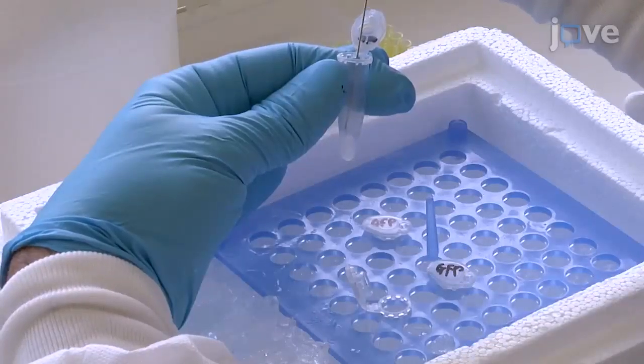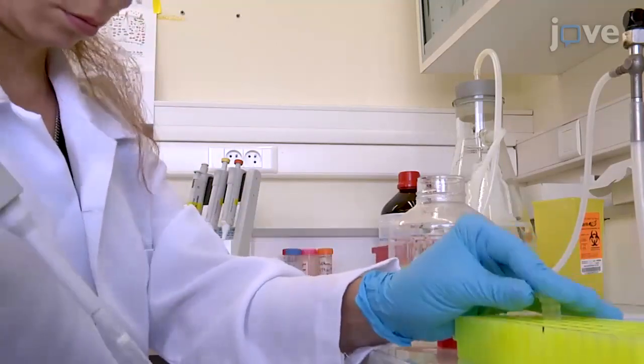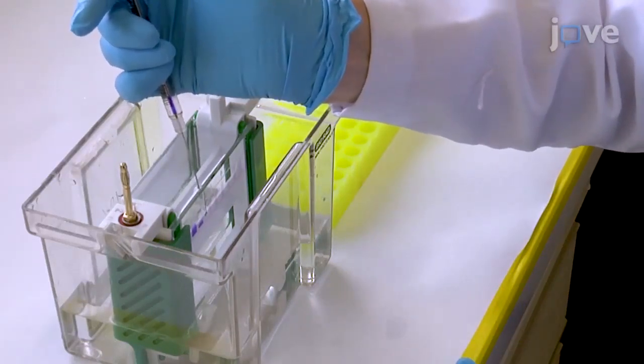This protocol contains many steps, among which some are critical in order to guarantee the final success of the purification and so the accurate establishment of the post-translational modification profiles. The procedure will be demonstrated by Mirna Swayden and Aurélie Dobric, 2 PhD students of the lab.